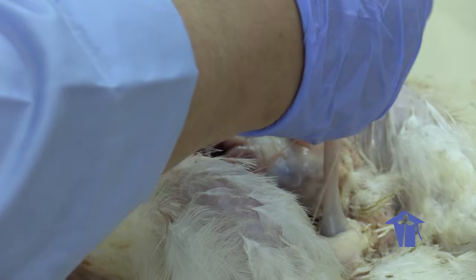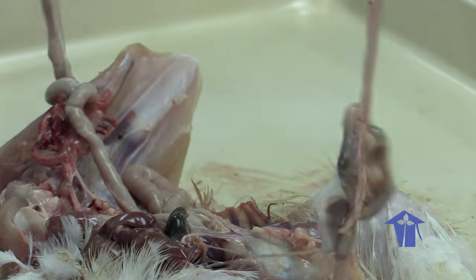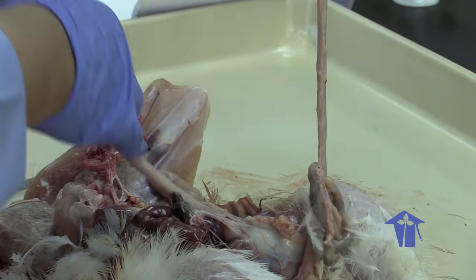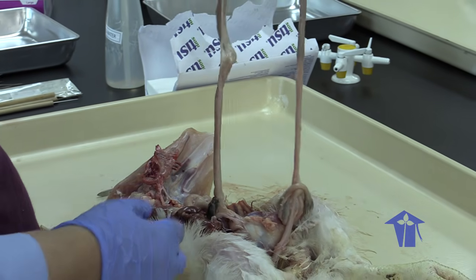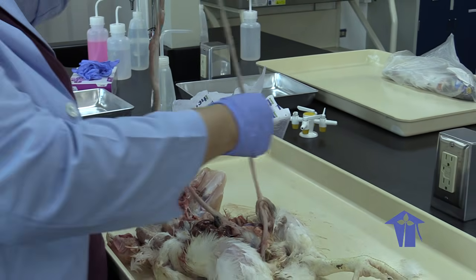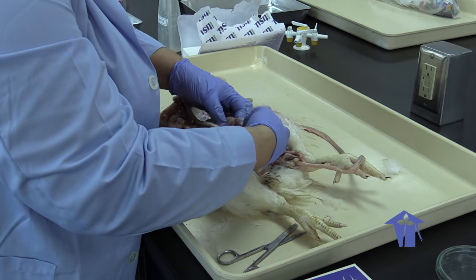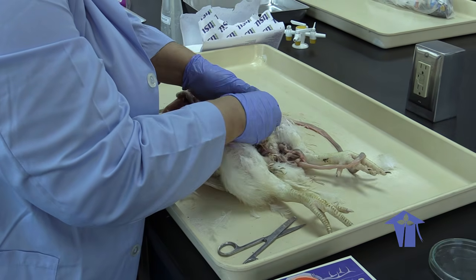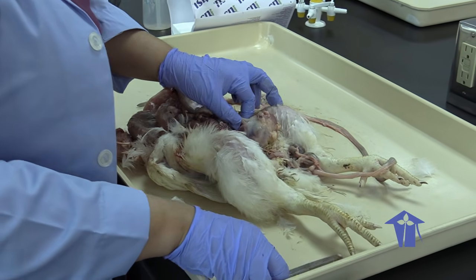So if I were to stretch out the intestine, you see that all of this was neatly packed into the body cavity of your chicken, right? It's a fairly long intestine for breaking material down. Now what I want us to do is to extract this gizzard, and I'm going to see if I could cut the gizzard open for us.